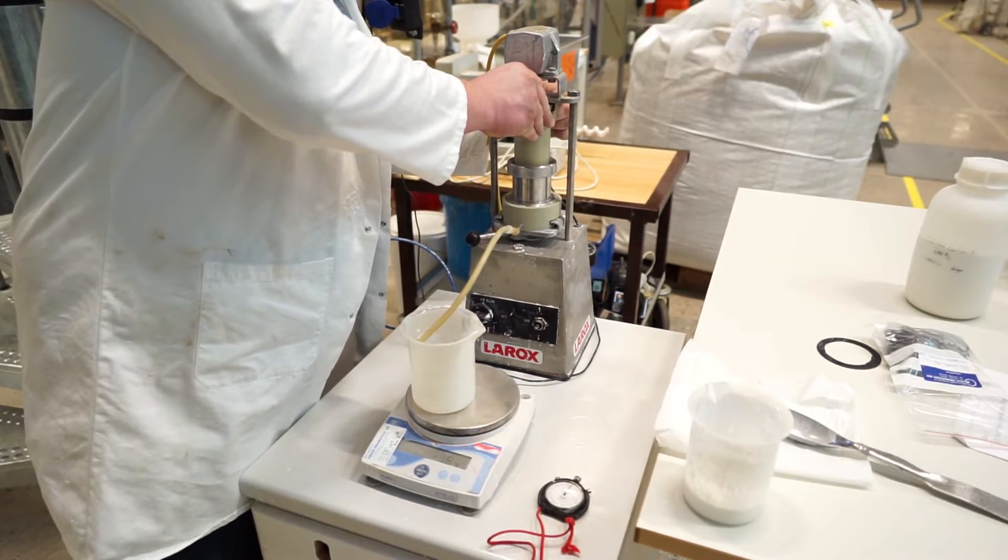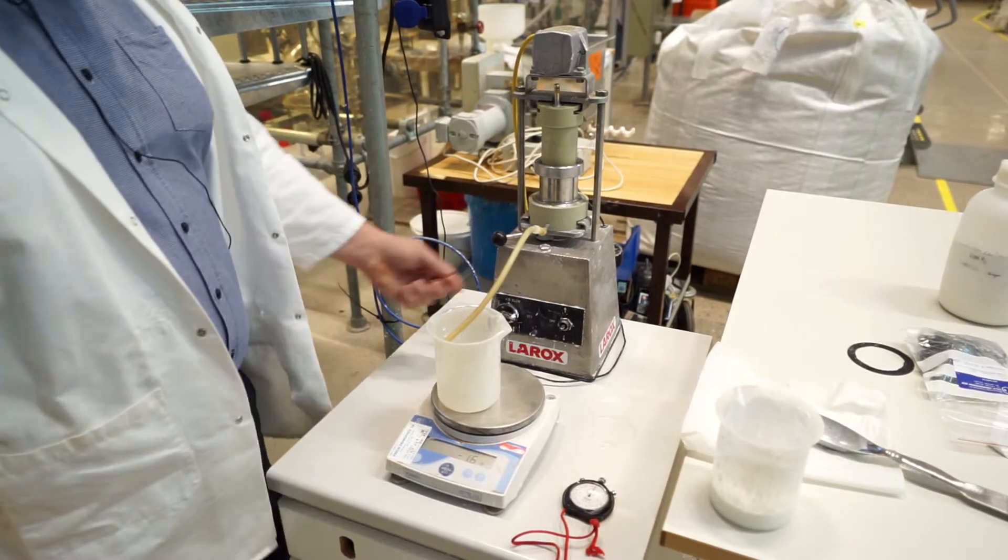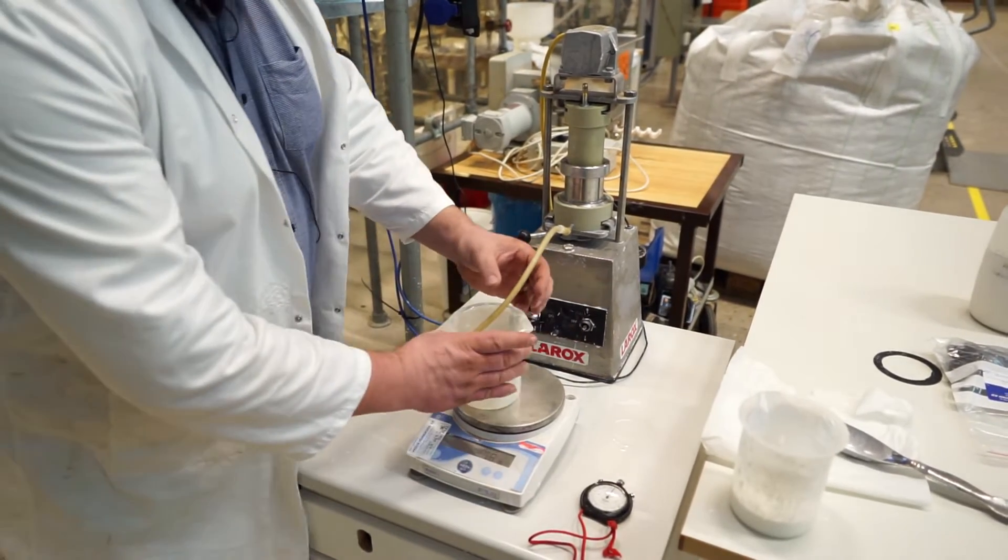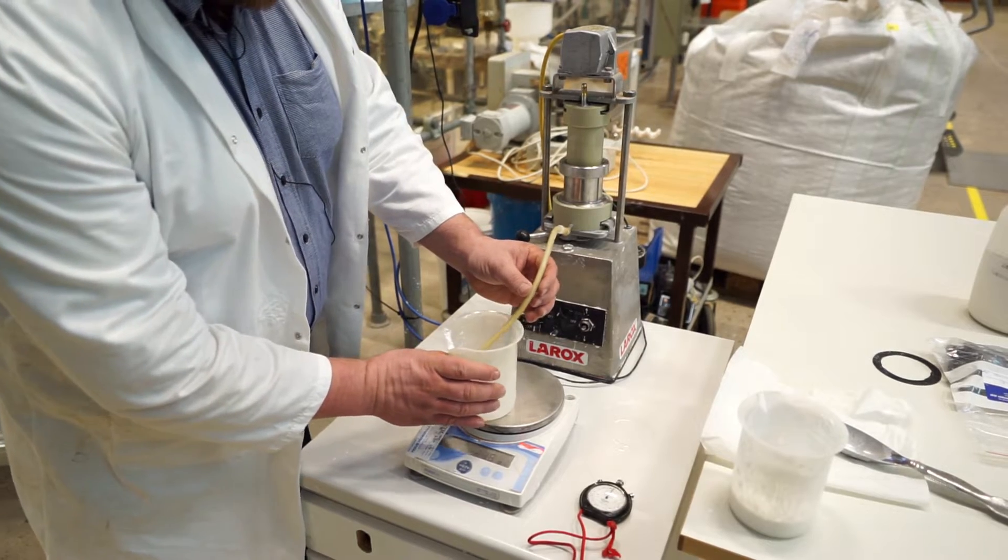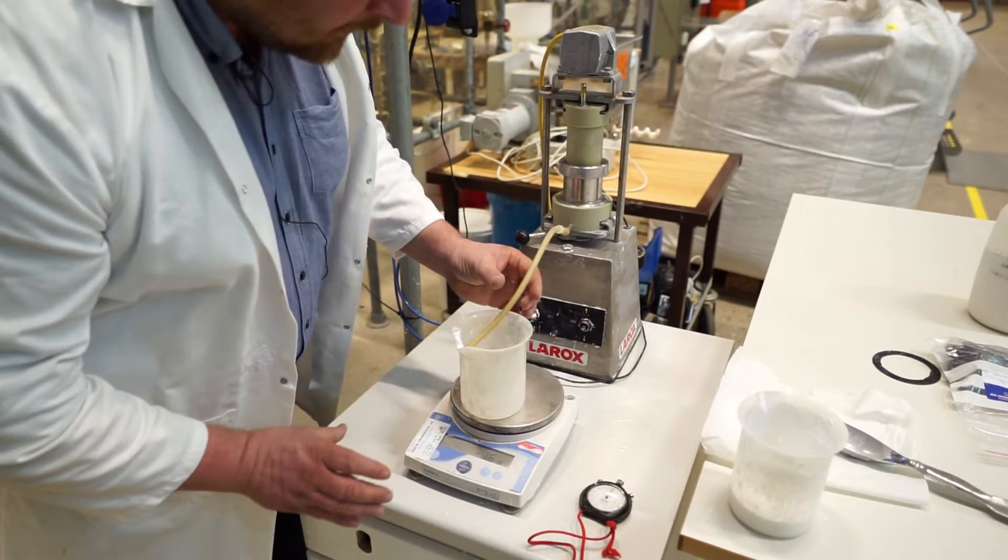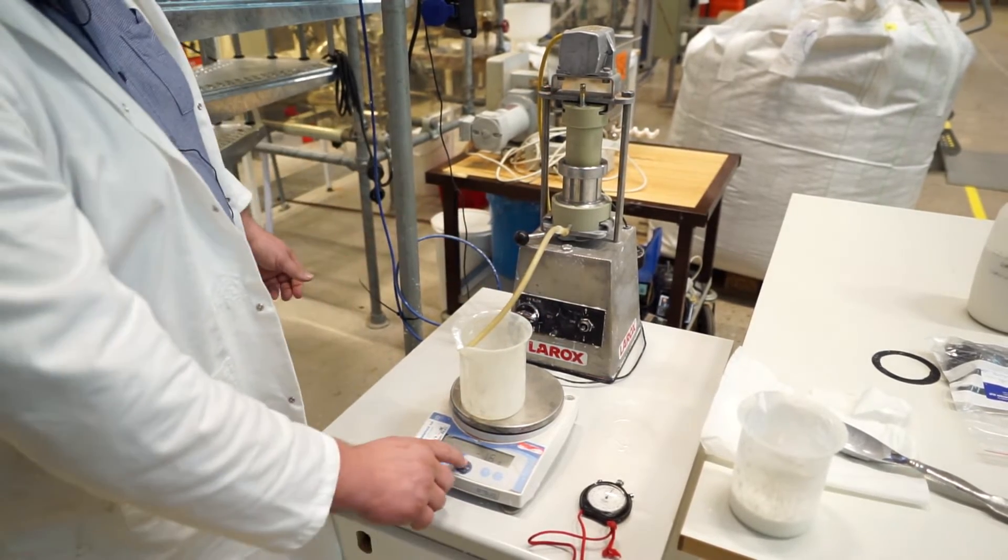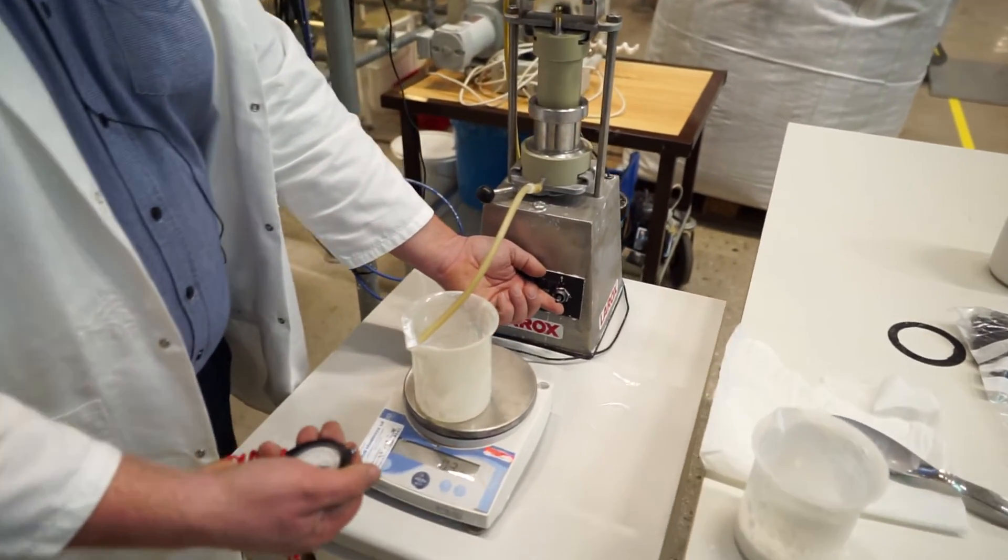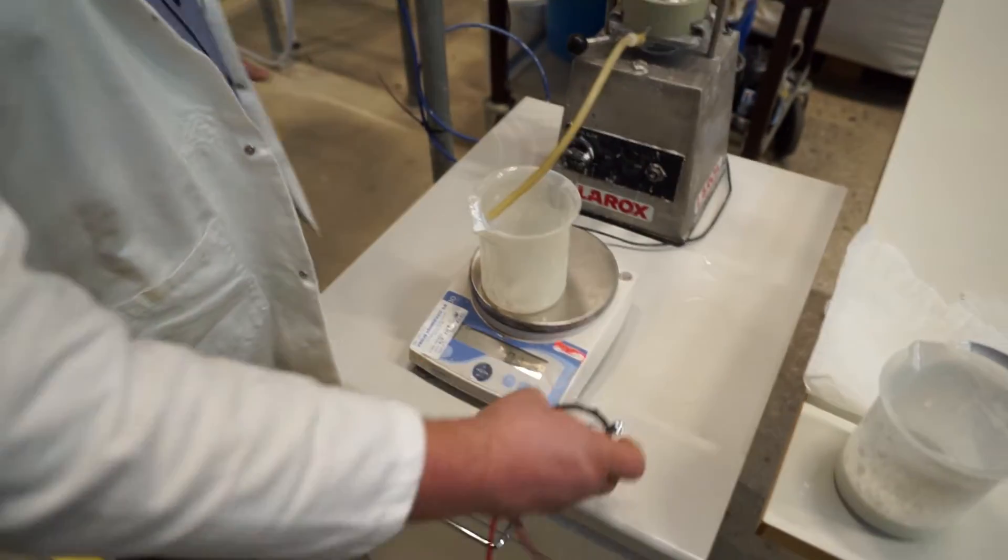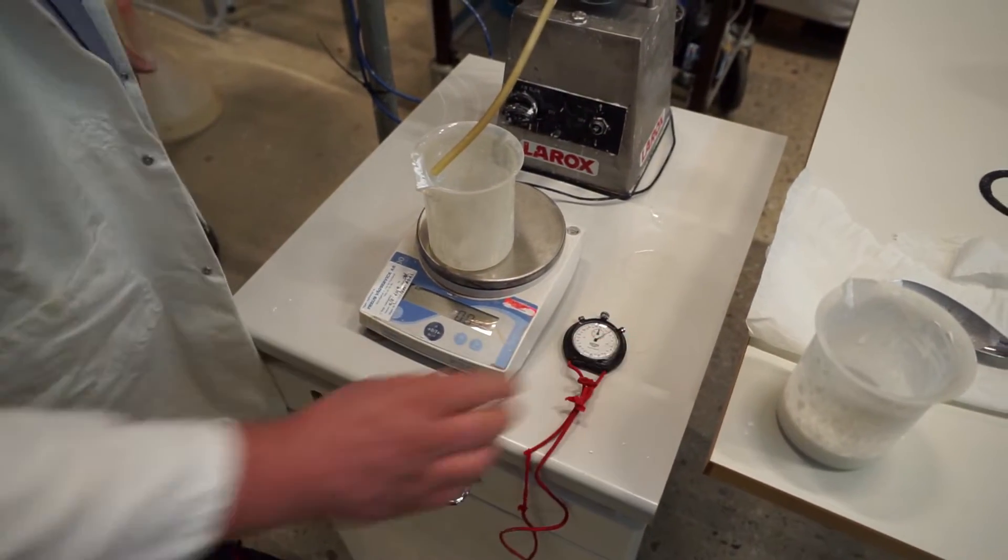And then let's see if we can make this so that you actually see something well. And then we have a scale there so we can measure. And start.